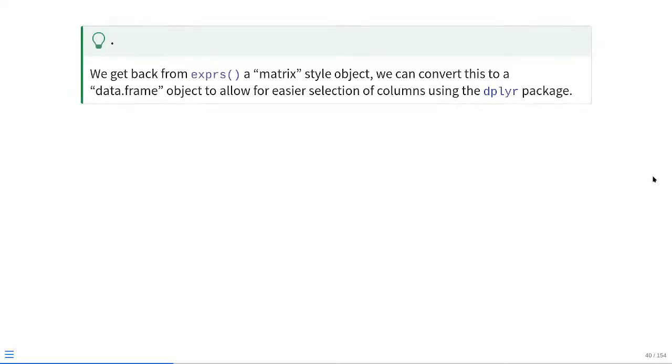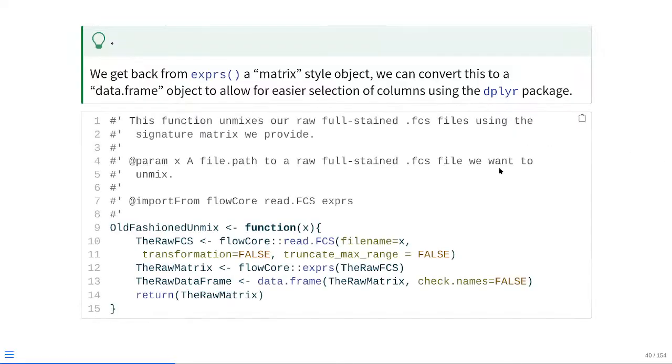Now, the easiest way of probably being able to select the detector columns from the forward scatter, side scatter columns would be using the dplyr package. So at this point, it's probably easiest to convert this matrix object over to a data frame, so that we are able to use the different tidyverse packages in terms of tidying the data. So let's go ahead and do that. In this case, taking the raw matrix output, we're putting it through the data.frame function, which will convert it to a data frame, and then at that point we can have it returned. And since we've added in another flowCore dependency in the form of exprs, we just go ahead and also update the @import tag from it, adding exprs there as well.